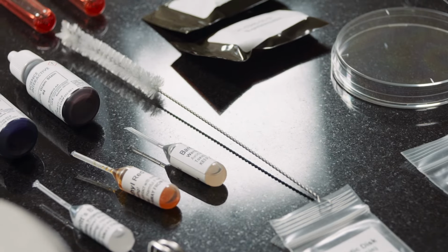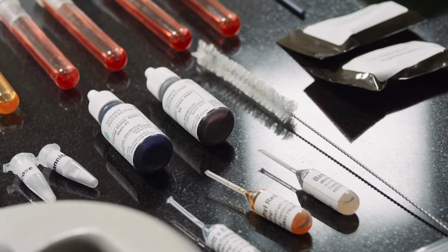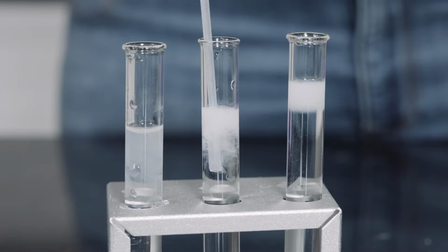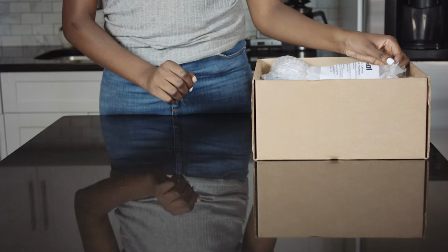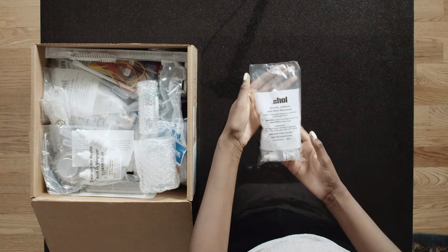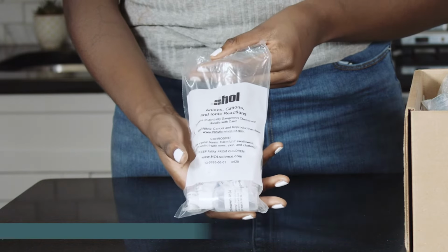No matter what lessons you choose, all of our microbiology kits feature lab-grade glassware, samples, and media. When performing microbiology experiments in a home environment, it is critical that materials are safe and consistent. We package all the materials students need for an individual experiment in what we call chem bags. This helps students stay organized throughout the semester.